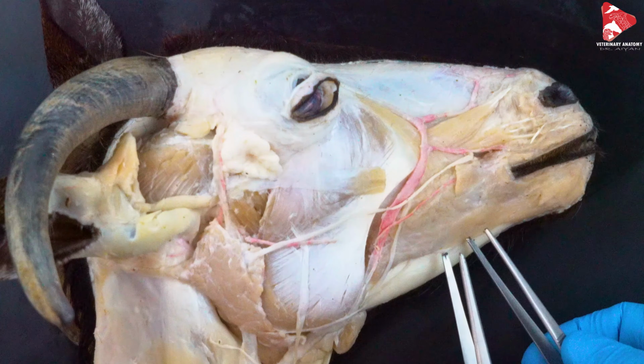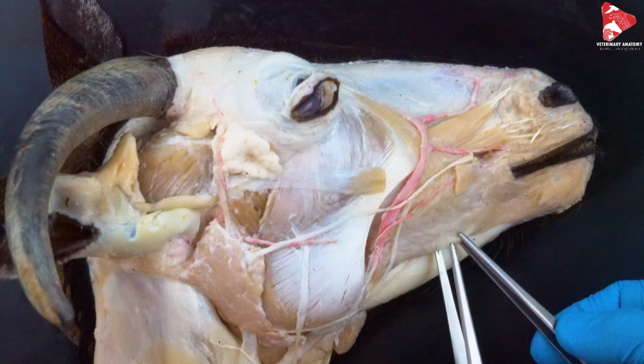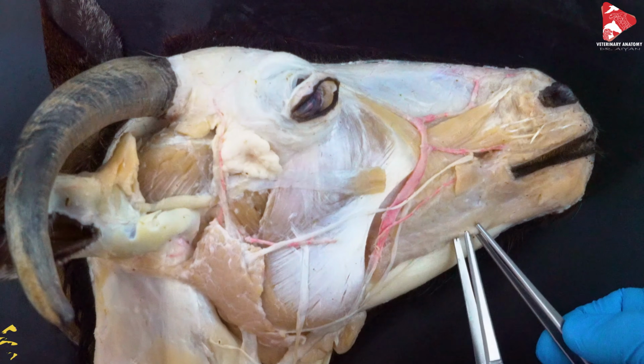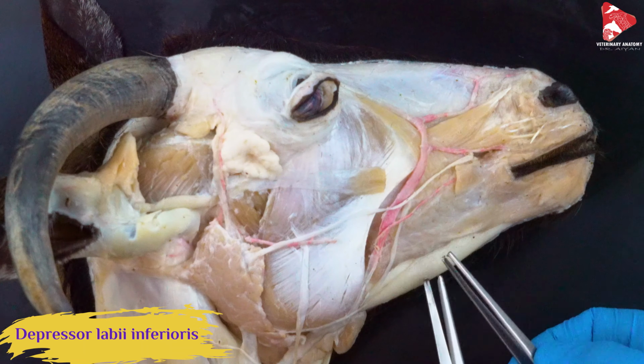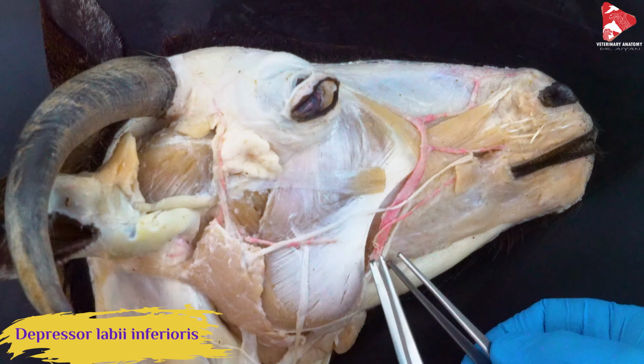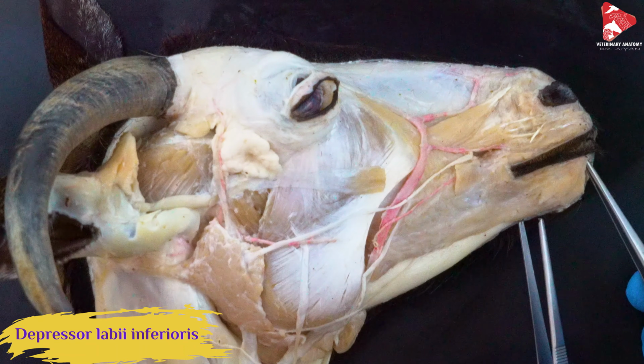If we move down here, we can see the other muscle responsible for moving the lower lip. This is the depressor labii inferioris. The depressor labii inferioris originates from the mandible, that region here, and inserts to the lower lip.